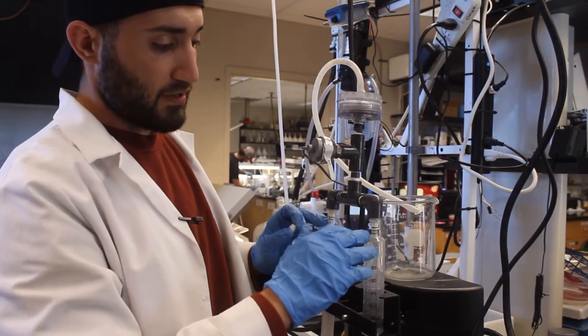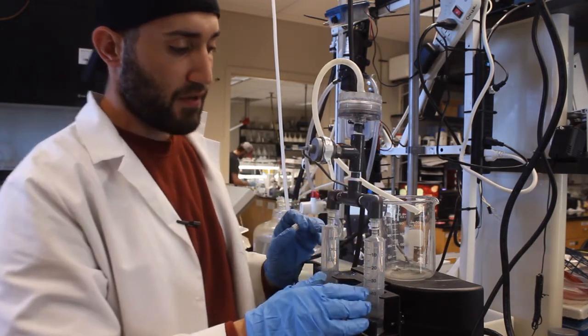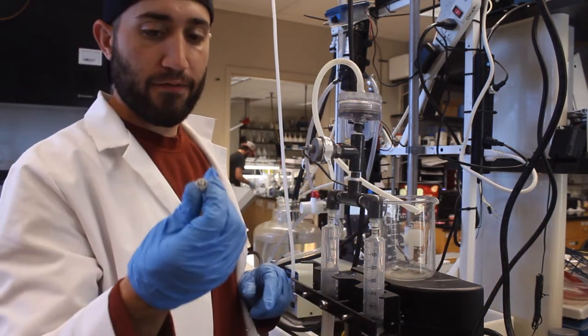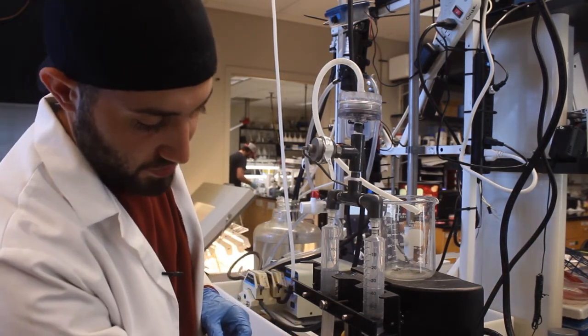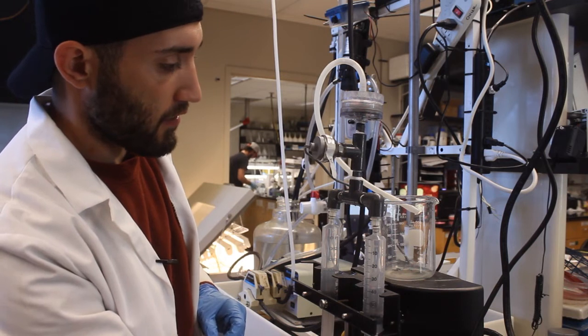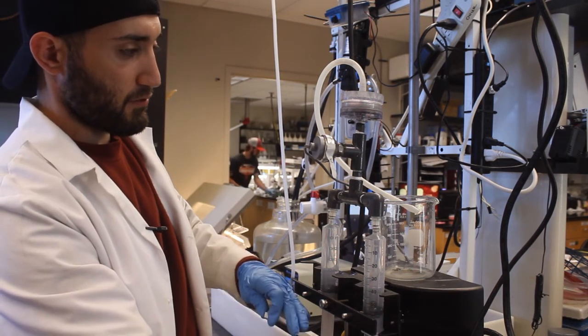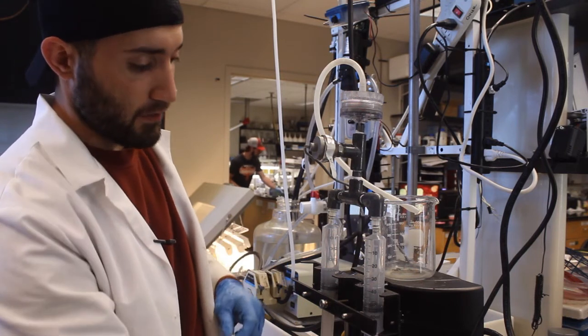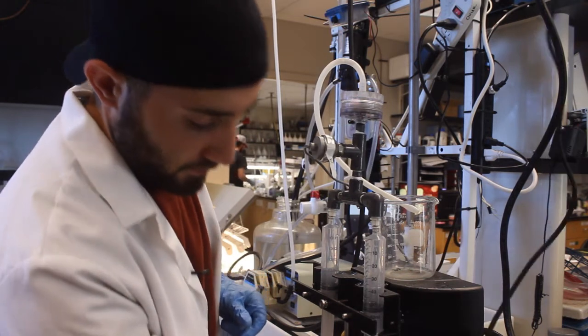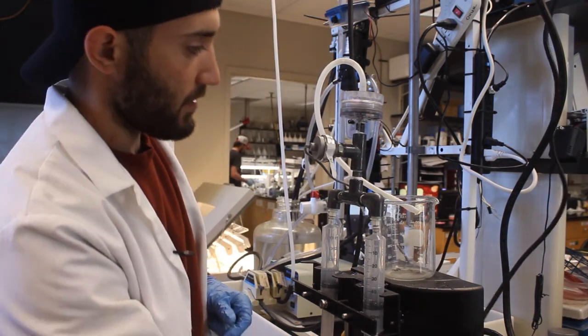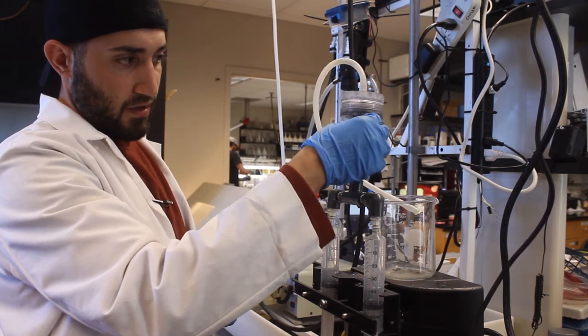For quicker start up, as the feed water is only in the syringes right now and there is a lot of empty volume within the piping, we remove the feed pressure relief valve and press inject on the syringe pump. Now as you can see the syringes are slowly moving up until we get a steady flow of our feed water into the membrane unit and then we will reattach the membrane.